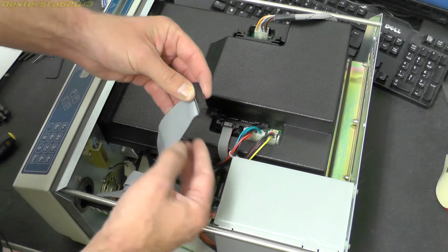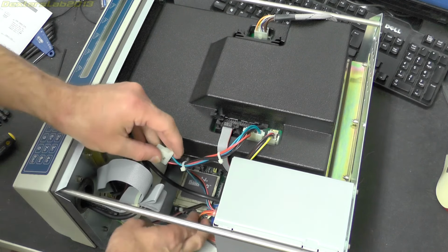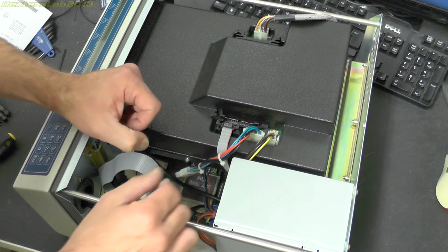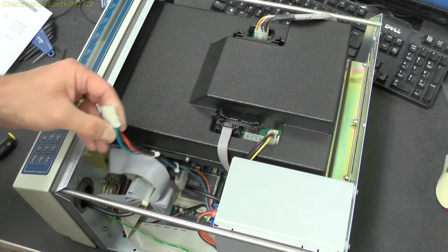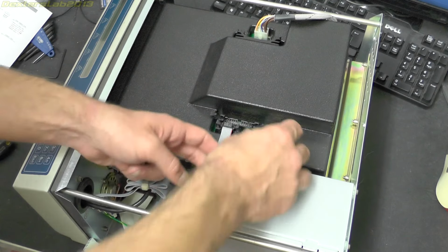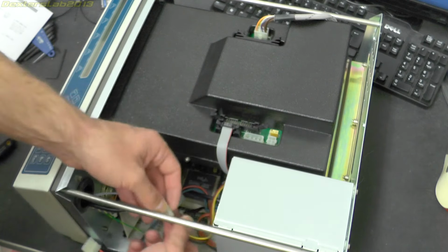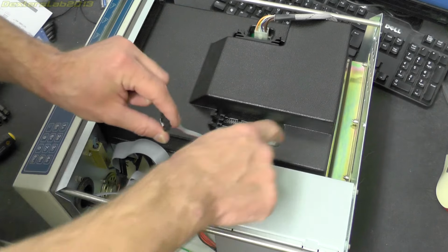Let's just remove that off there. So that's just a ribbon cable. We've got, oh right, I can see here now that the power supply is just here, and they've got power cables strapped on here, coming up to this assembly at the top, and this connector is just a standard PC Molex connector, so that's obviously providing the 12 and 5 volts. This connector here is also connected to the other power supply wires, so that's possibly some of the other voltages that come out of an old school power supply. And the last cable there is titled RS232 interface, and that disappears down under there somewhere.